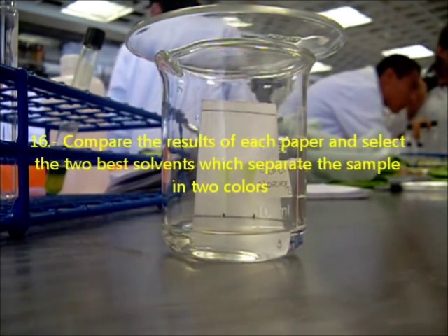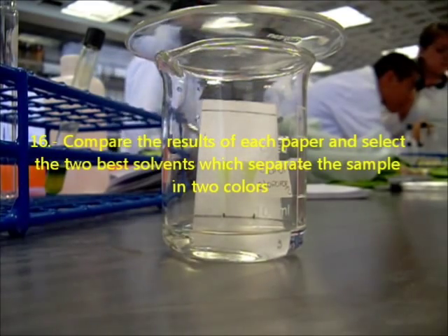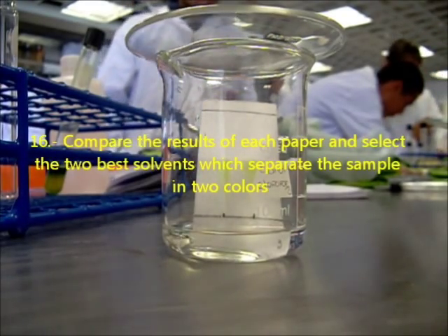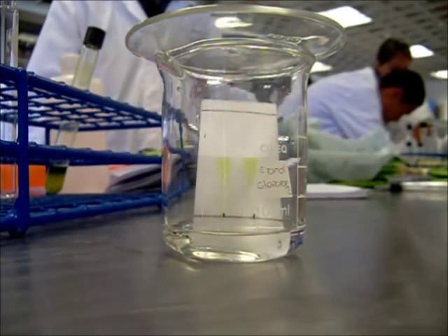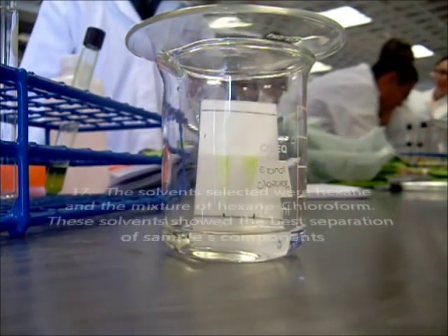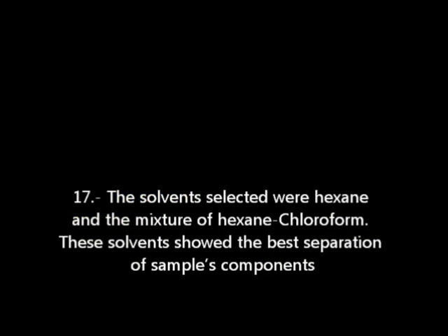Compare the results of each paper and select the two best solvents which separate the samples in two colors. The solvents selected were hexane and the mixture of hexane-chloroform. These solvents show the best separations of sample components.